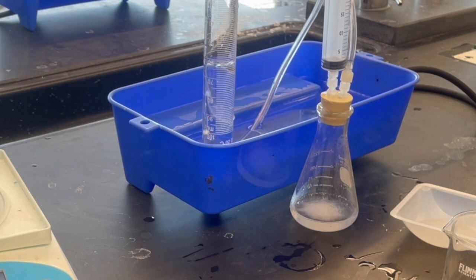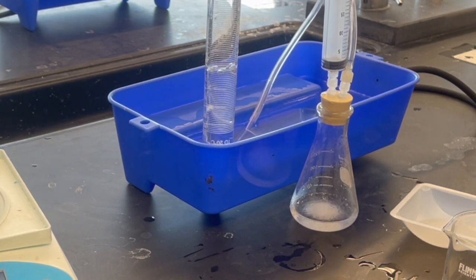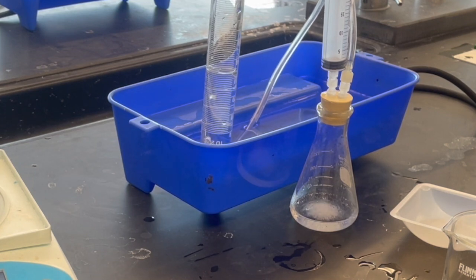The reaction is going to run until all of the baking soda has been used up and the bubbles stop forming inside the upside down graduated cylinder.